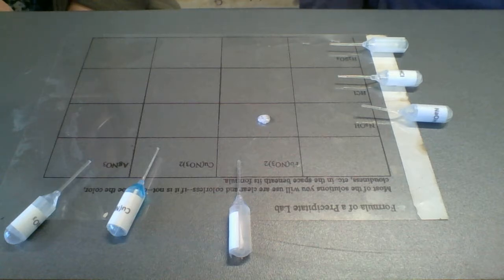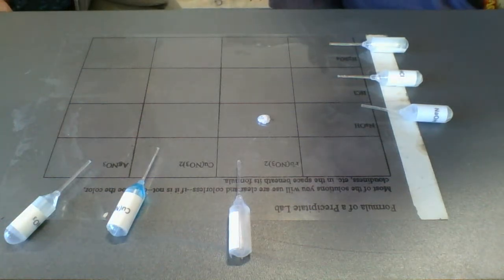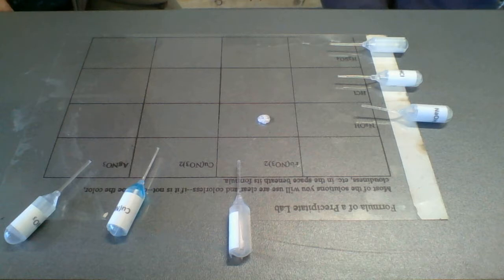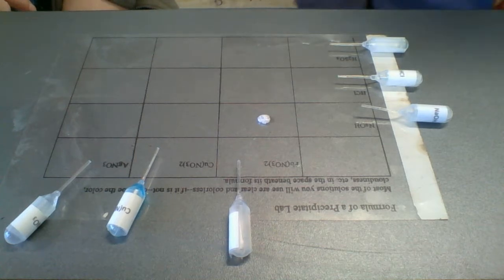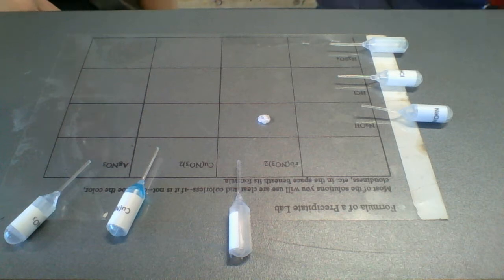Now, how do you know what's happening? It looks like there's kind of chunky stuff in there. Little cloudy, white. Okay. Do you think that's that thing that we called a precipitate a little earlier in the lesson? I think so. I think that's how we would know. Okay. So in real life, we actually see something.